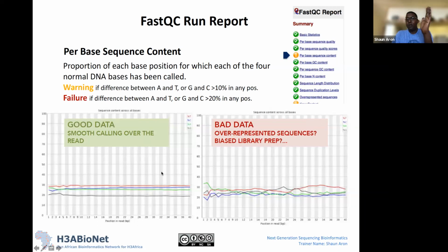The reason for this is that we expect there to be no bias in terms of particular bases at a particular position, okay? If that is happening in our data, you end up with more jagged looking lines, where we seem to have over-representation of a particular base at a particular position. Sometimes if your data is noisy, this will be observed. So you just need to be a bit careful about how you interpret this graph. You might also find that there might be a bit of noise at the beginning and the end of the sequences again. So just keep that in mind.